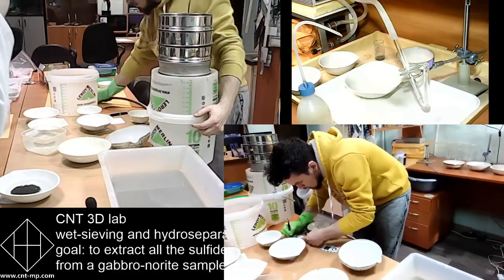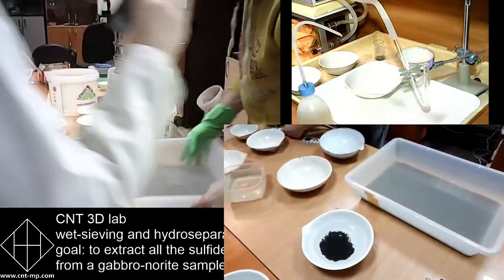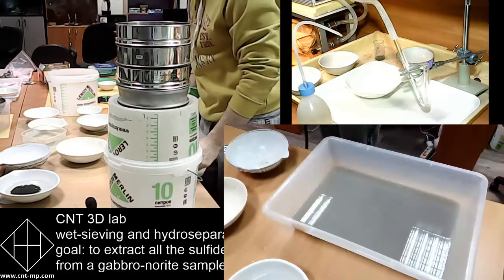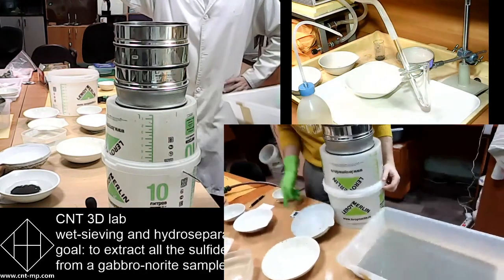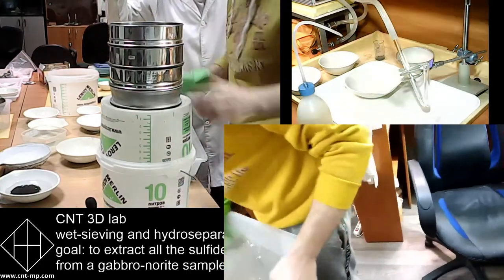So we had primary weight of the sample that went to EPD. There is oversized +1 mm, and there is undersized -1 mm. So +1 mm can be weighed, dried weight, and deducted from the primary weight of the sample. So it hasn't been used for hydroseparation.